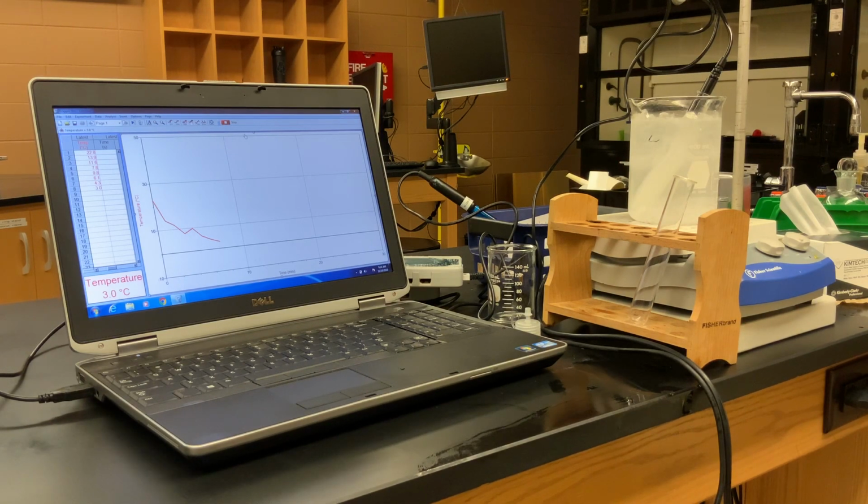And so I mixed around the ice and the rock salt a little bit more, and that got us back on the right track. So that 9.8 degree mark, even though we were still at a mixture of liquid and solid, that temperature shouldn't have spiked that high. It should have gone down a little bit more, below 7.8, but that was a little experimental error on my part. I turned off the stir plate mechanism. So I realized now, hey, I need to keep this stirring.